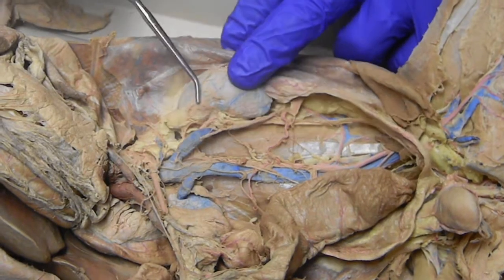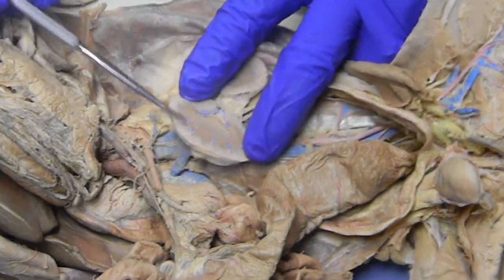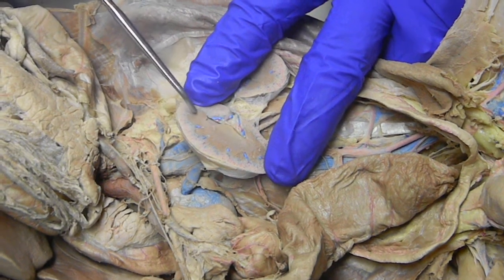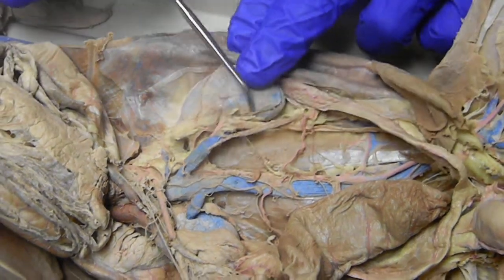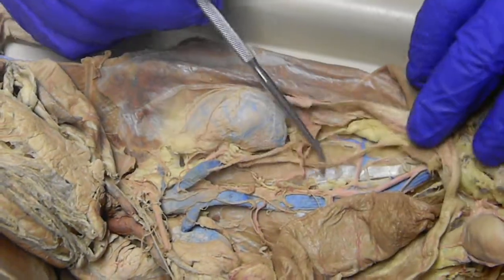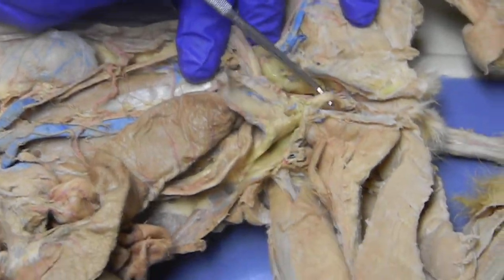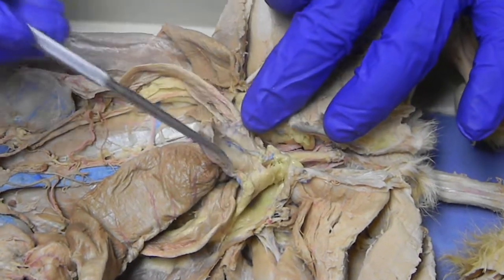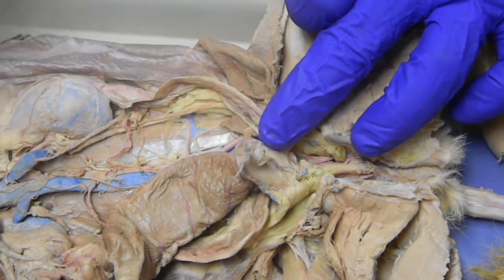On the back body wall, we have the kidney and the adrenal gland. The kidney, if you open up the cat, has only one pyramid, but you can definitely see the outer cortex, the whole center of which is the medulla. This is also the renal pyramid and the renal papilla. Coming from the renal area right here is the ureter, which drains the urine down to the urinary bladder, which is right here. And then this is the urethra going to the outside. The bladder is held in place by three ligaments: two lateral ones, sometimes called the umbilical ligaments, and one medial one right here called the median ligament.